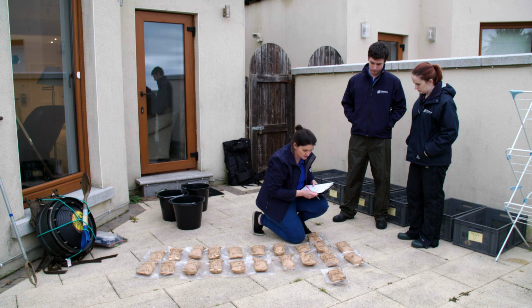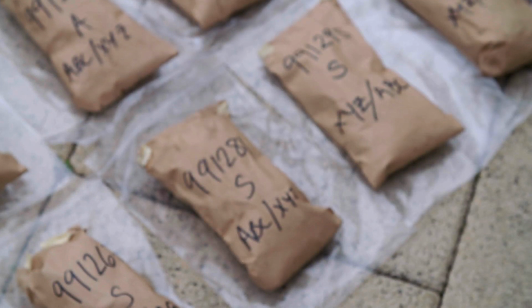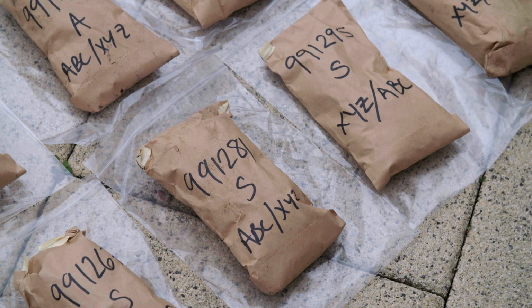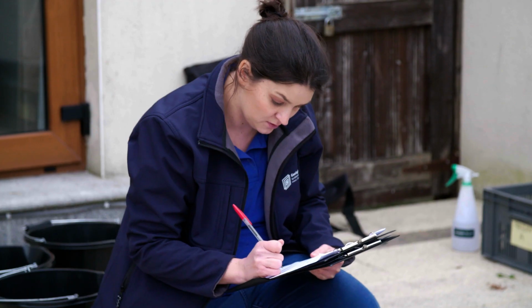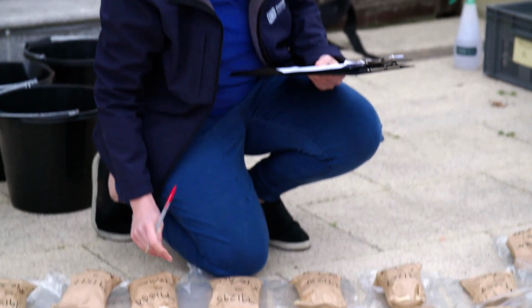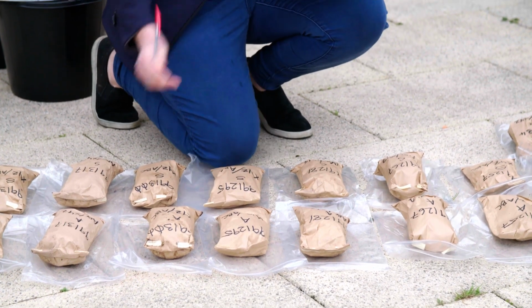All samples should be checked in against the soil random number checklist. Ensure all bags are labelled on the front, suitably full and correctly sealed, with the tabs wrapped around to the front. Check that each and every sample bag is intact. A complete set of samples from every site allocated to the team should be collected.